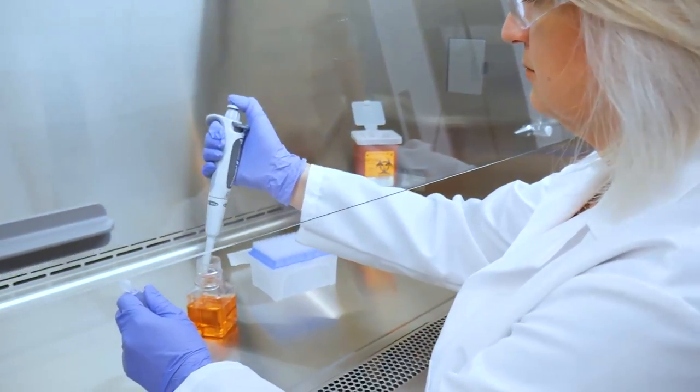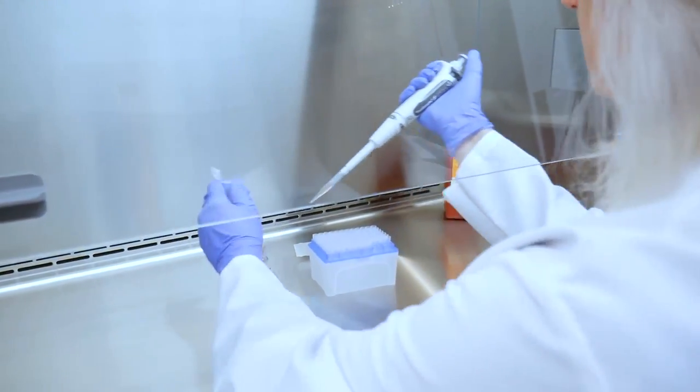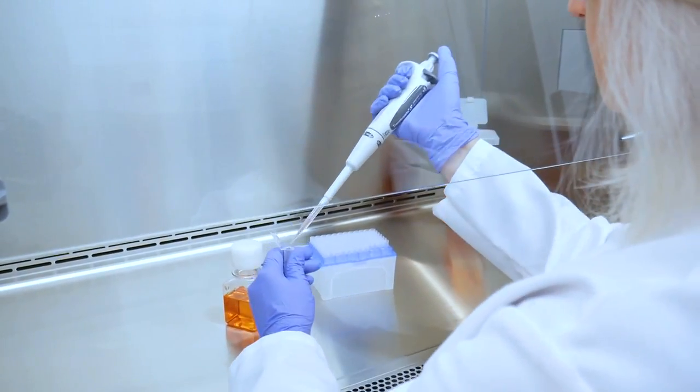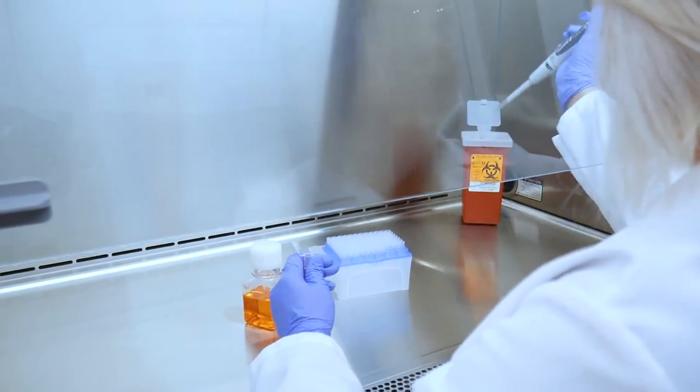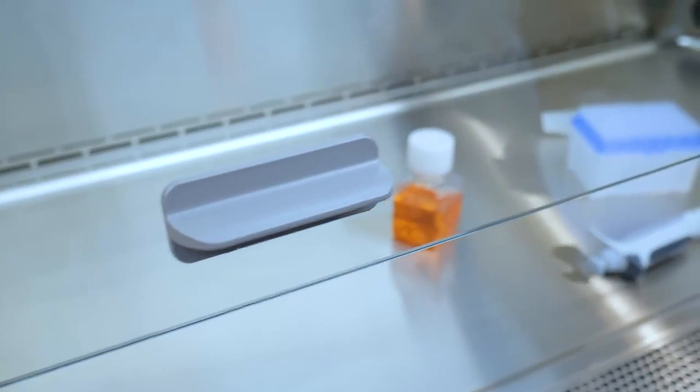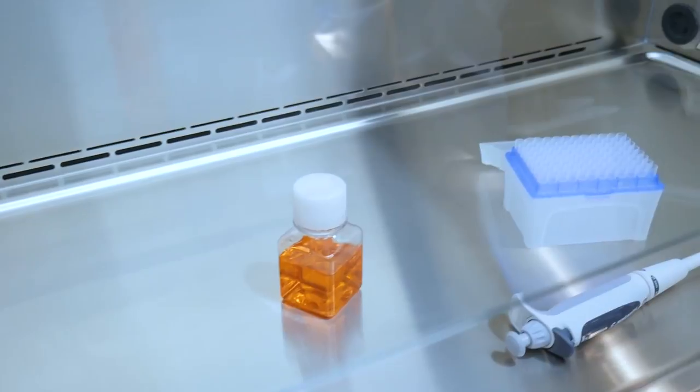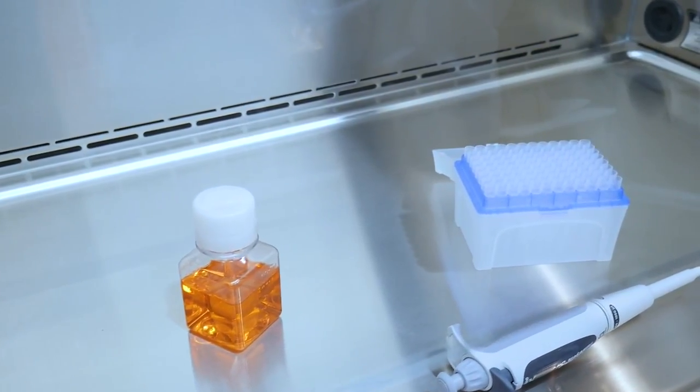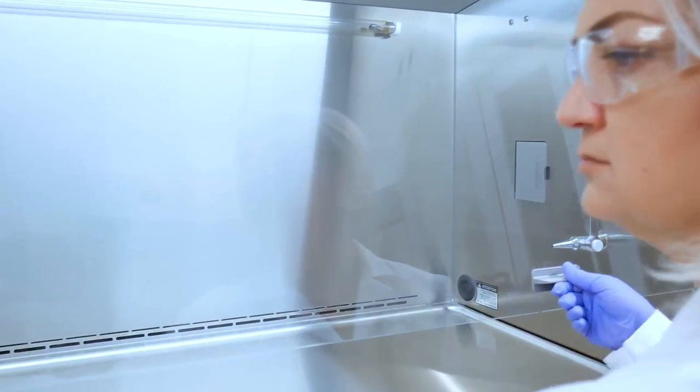Your biosafety cabinet is a powerful tool designed to keep you and your work safe, but it is not a substitute for proper technique. All work within the cabinet should be pre-planned and movements should be slow and deliberate to minimize airflow disruptions.